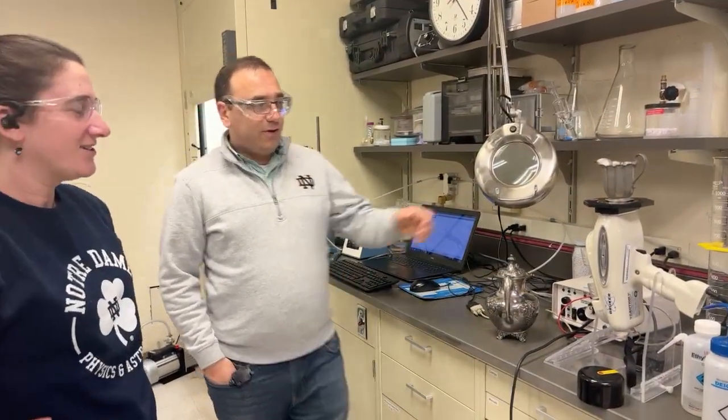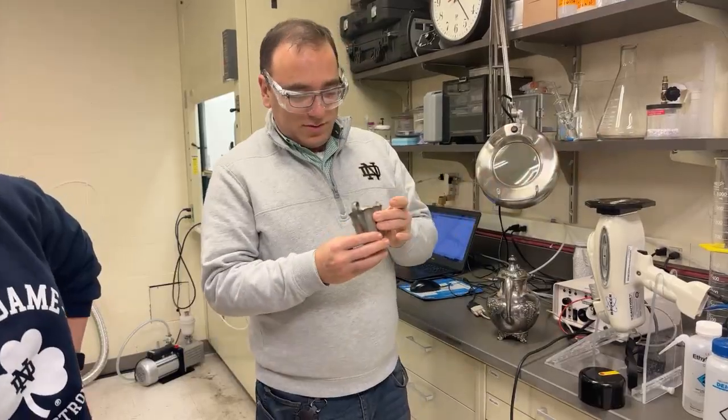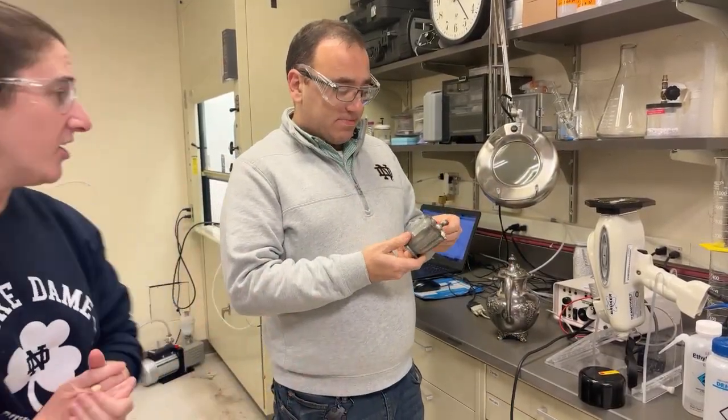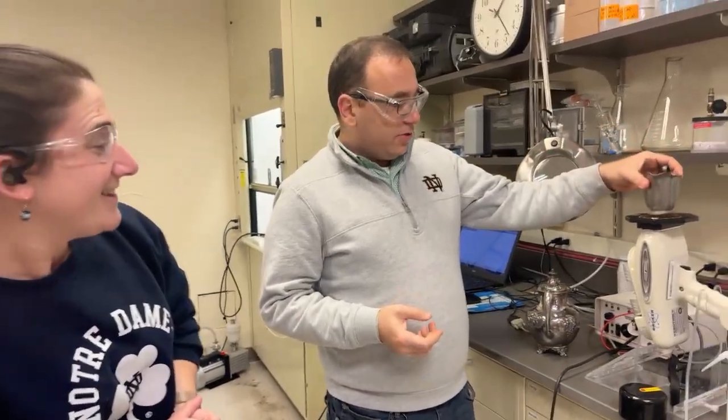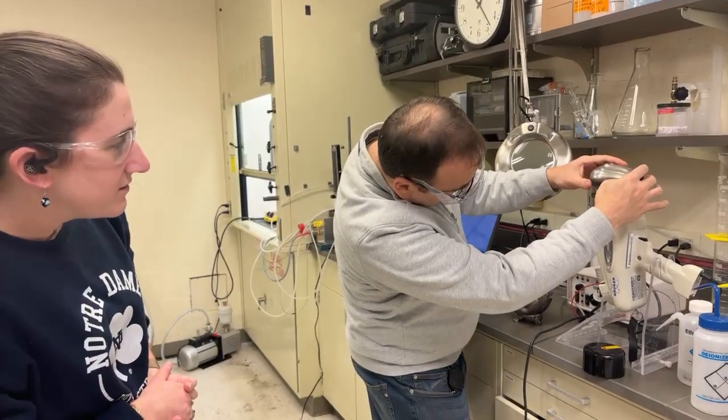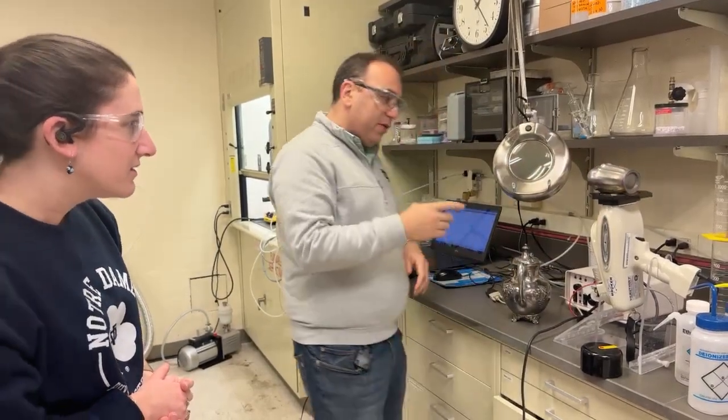Okay, so we will start with these. Which do you want to start with? Yeah, this is good. This is the one that's supposedly pewter. We could just put it here or this way, the way that has better contrast. I think that should work.